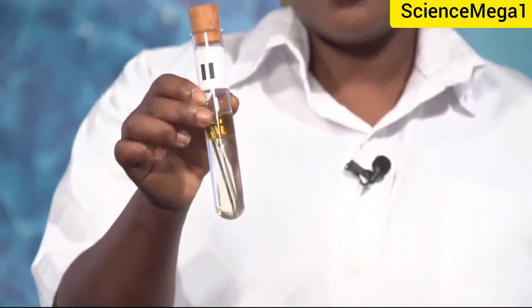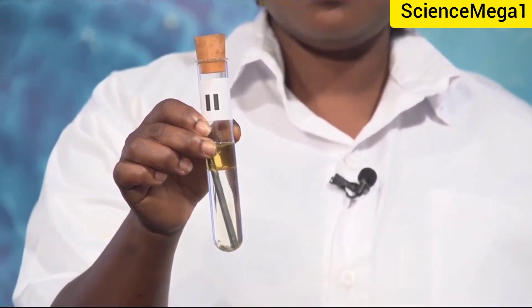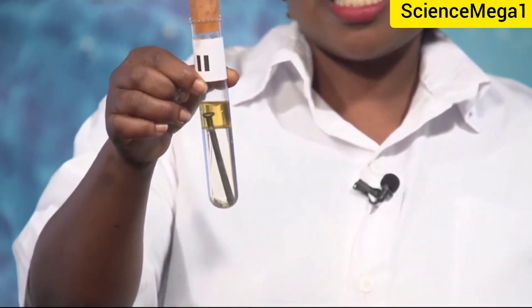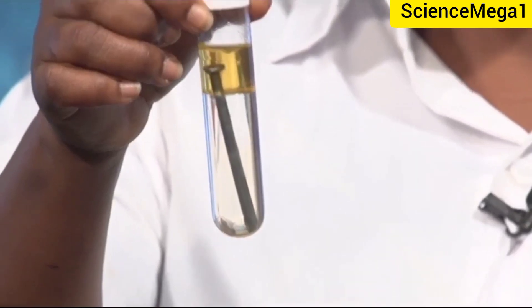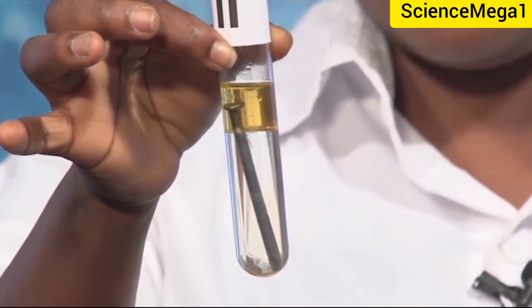Test tube two has also been filled to about half with boiled distilled water and a nail placed in it. The water was boiled to remove any dissolved oxygen or air. The tube has been corked and a little oil poured over the surface of the water to prevent air or oxygen from dissolving into the water.